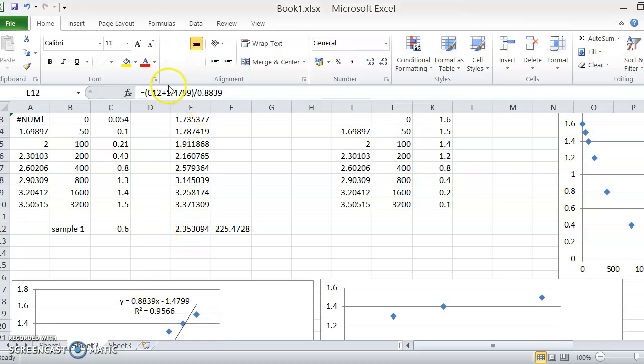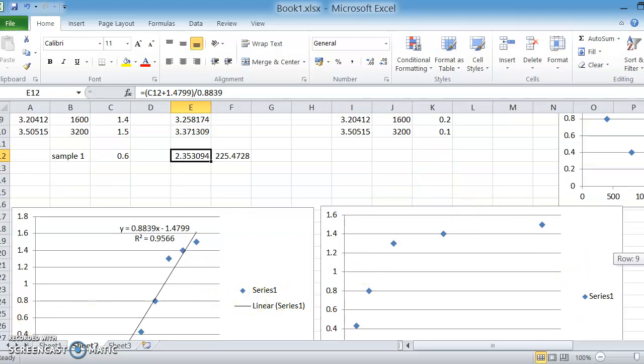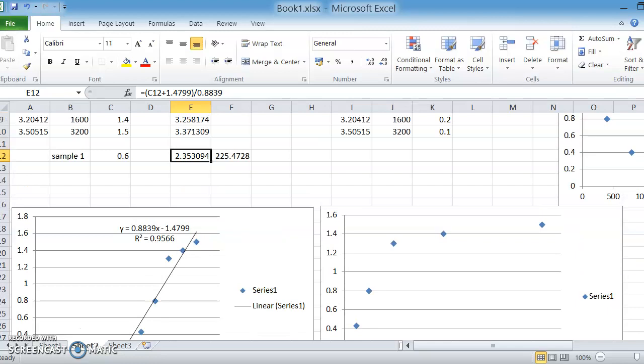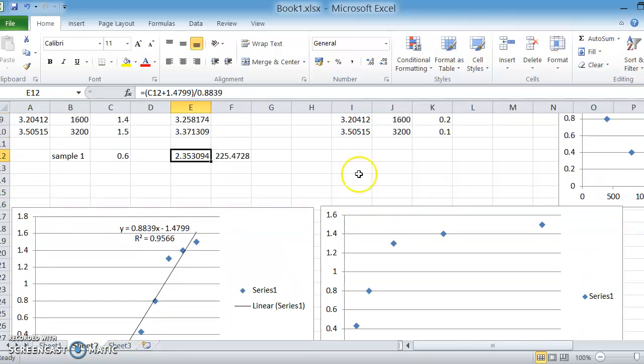So by rearranging all of that, we've created a formula that basically puts 0.6 into this equation, and it throws out the number 2.35. Now 2.35 is effectively what you get when you read off this graph. You go along to 0.6 and you come down and you get to 2.35. Now we need to then convert that into the real number. And this is where you use, on Excel, the power function.